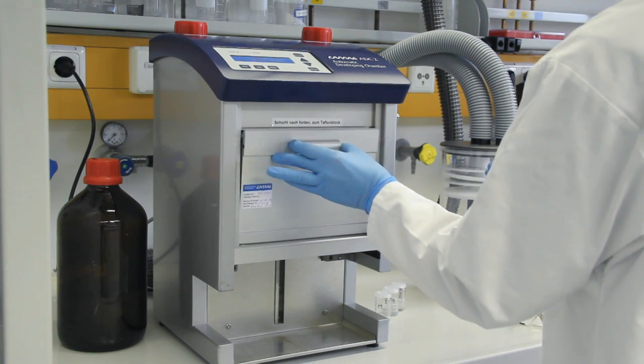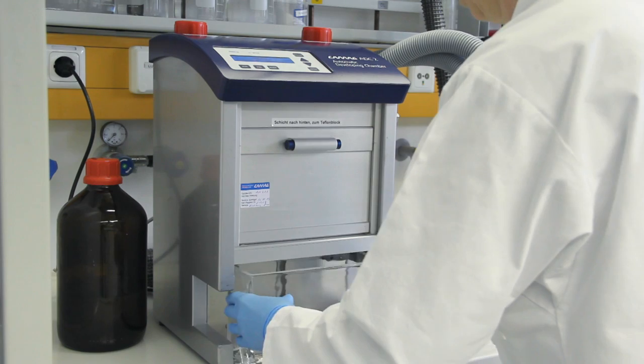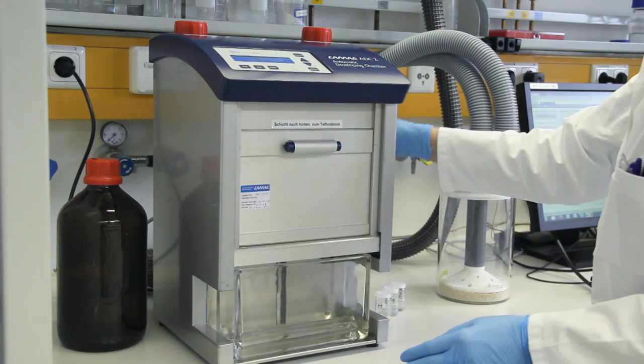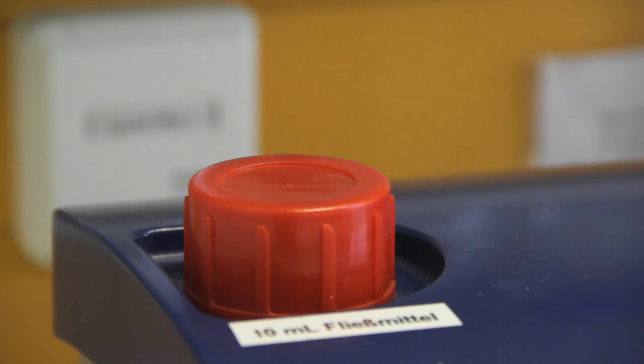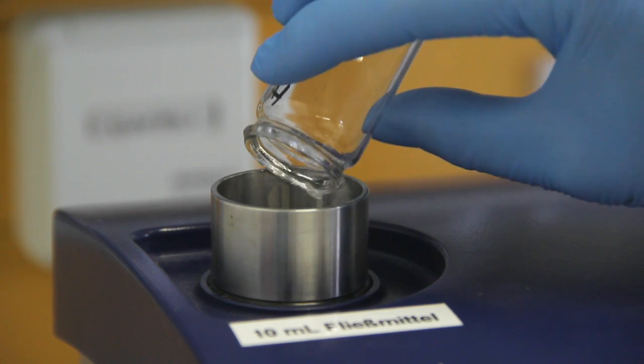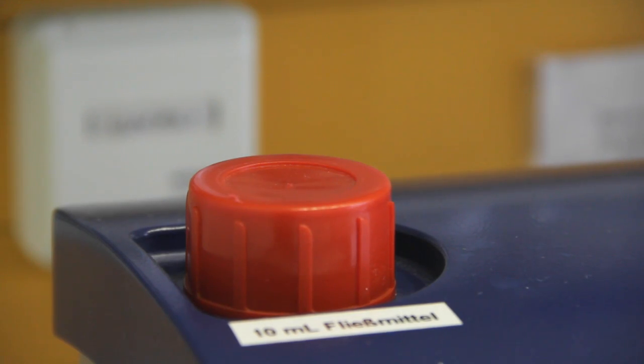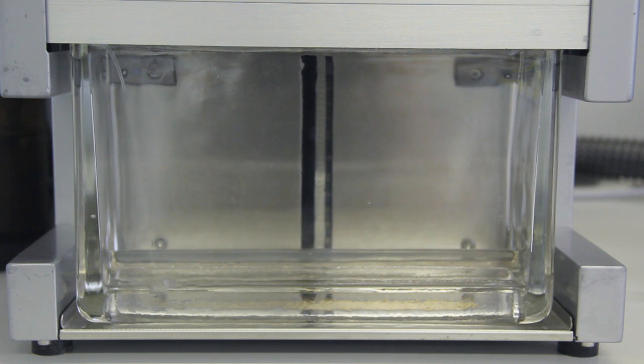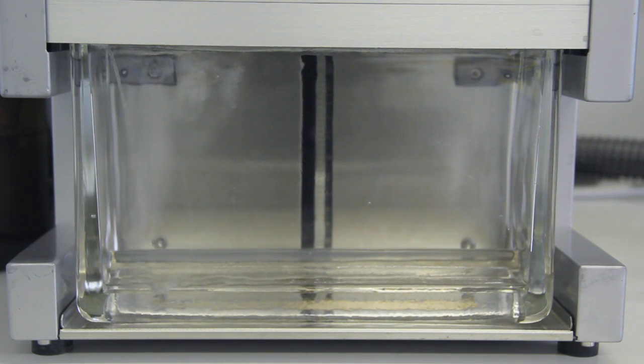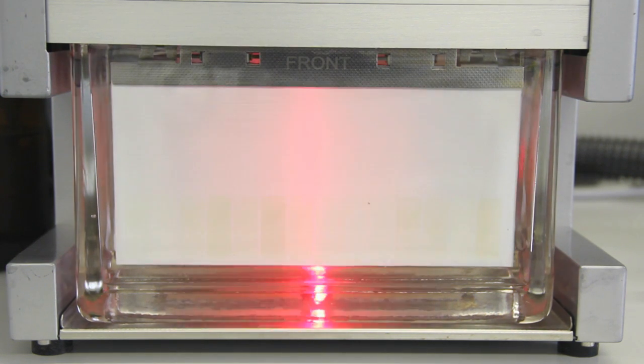Focusing was required for front elution of the analytes. Thereby, the matrix remained distributed over the start zone. The focusing step was performed with isopropyl acetate up to 35 mm and then repeated, taking all in all 10 minutes. The focusing solvent was poured into the chamber from the left corner. The plate was lowered into the solvent and the focusing, meaning the front elution of the analytes, started.